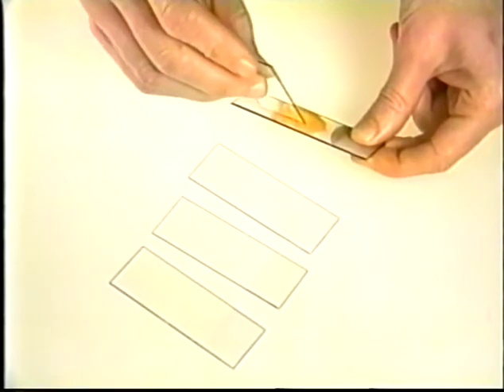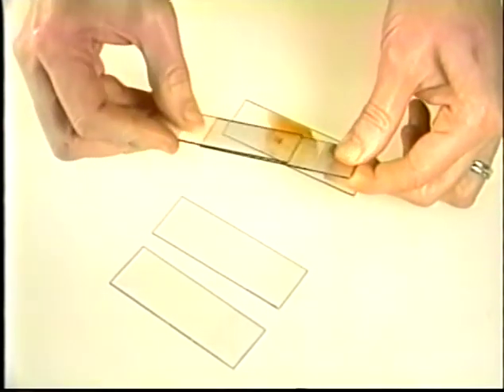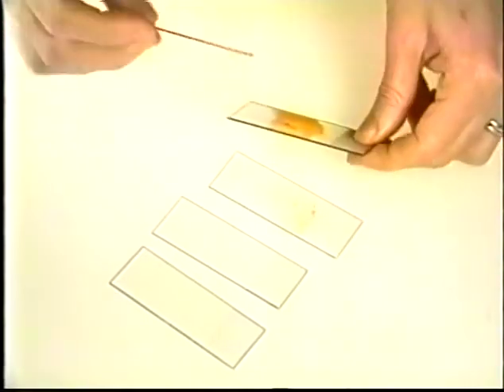The finished smear consists of tissue fragments smeared out in a thin film of fluid that will not interfere with the interpretation. The concentration and smearing may be repeated several times from a single slide.